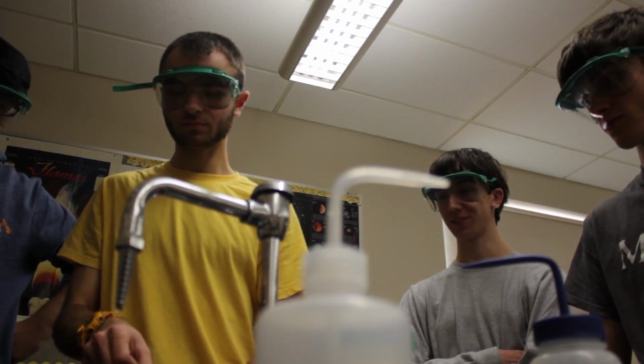Students entering into the laboratory have to be very conscious of safety features, and so it's very different than in the middle school setting. We wanted to create a way for younger students, as well as students in underfunded school districts, to get hands-on experience in a whole new way.